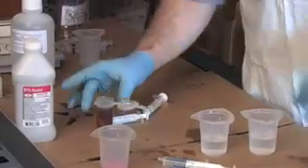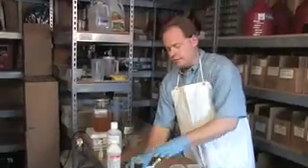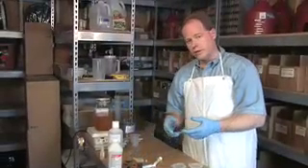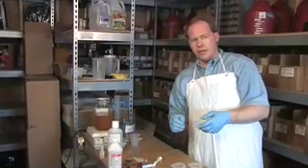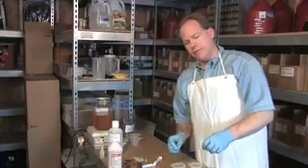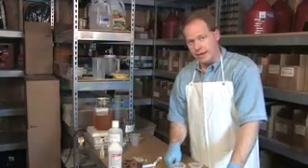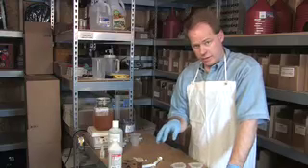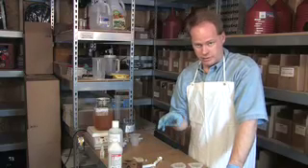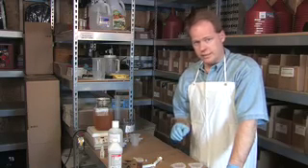It's important to do the titration about 3 times to make sure you've done it right. You want to always redo it and double check your math. If after 3 times your numbers are plus or minus 1, that's your number — the average amount is going to be your titration number. We'll pause here for a moment, do another one, and get set up.